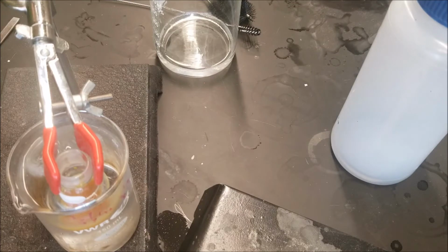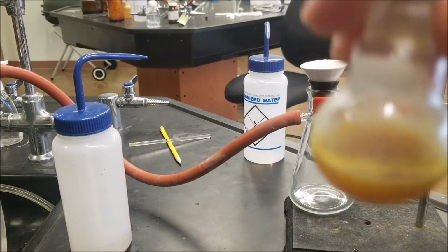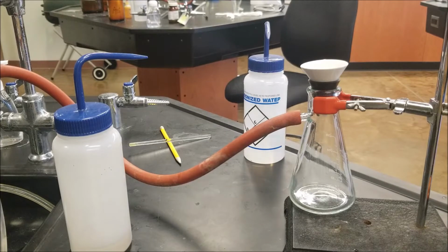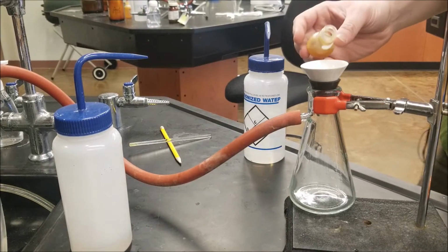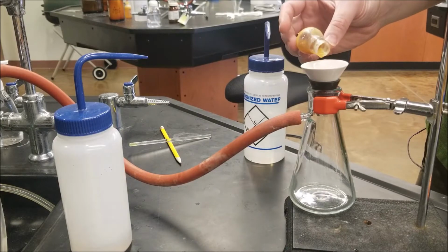and then we're going to filter this out and let it air dry overnight. Okay, it's been approximately 30 minutes, so I'm going to take this and try to filter it through a Hirsch funnel, and then wash it with ice water. Let's see how well this works.